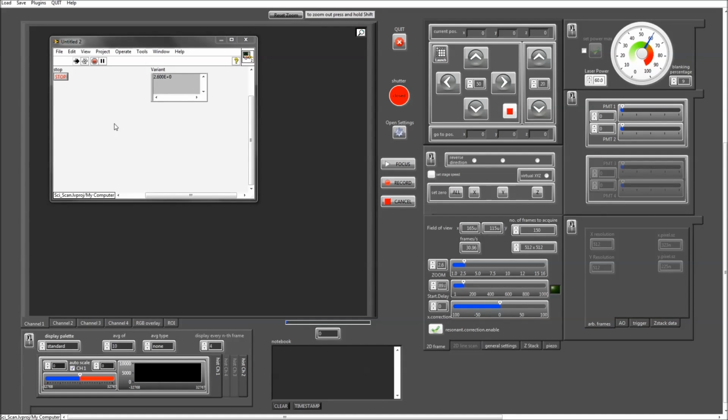Even if you have your workflow software in something like Python or MATLAB or C++ or anything else, there's always an option to interface those with LabVIEW, for example, through ActiveX. And we can then, within LabVIEW, make use of this GFG to have access to all the variables that are in use behind the scenes in SciScan. You have access to all the front panel elements.